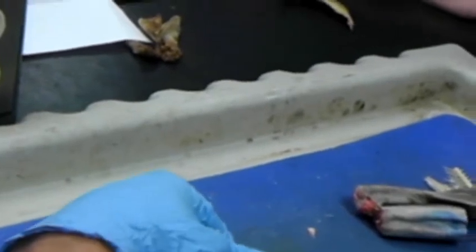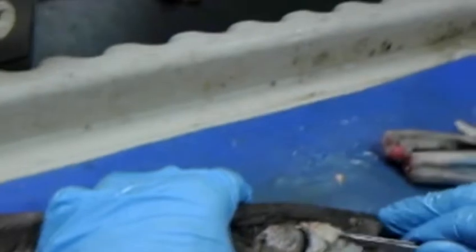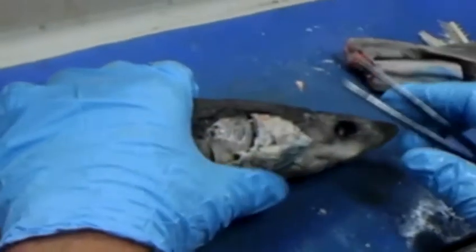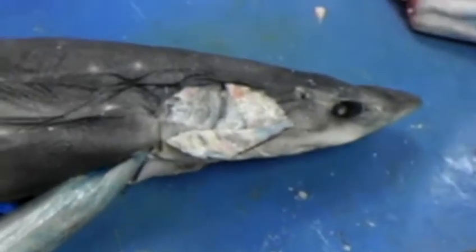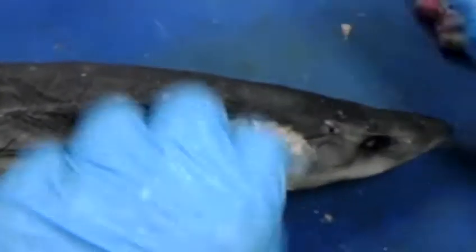You will have some muscles right around the gills. So here's a few muscles in here, and that helps flare those gills. You've heard that sharks can't breathe unless they're moving. There might be some species like that, but they do have muscles to pump. So I've seen sharks sitting on the bottom, not moving, and can still make those buccal pumps work with these various constrictor muscles.